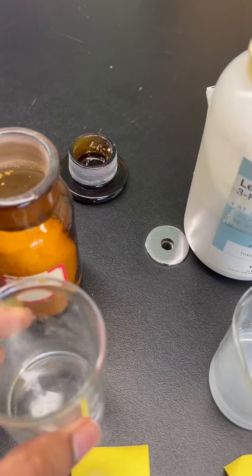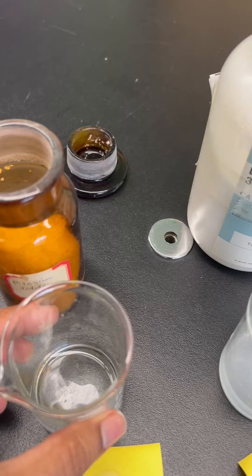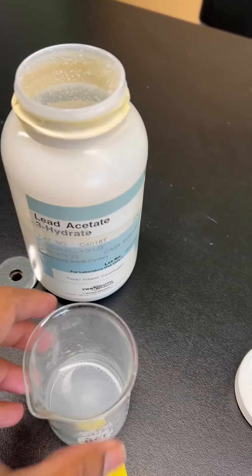I just dissolved a little bit in some distilled water, same thing with the lead acetate.